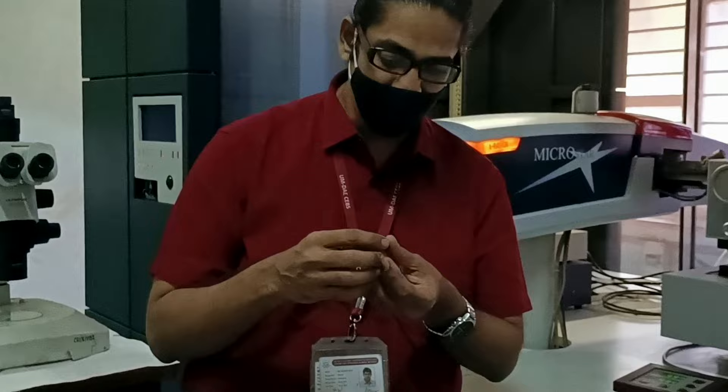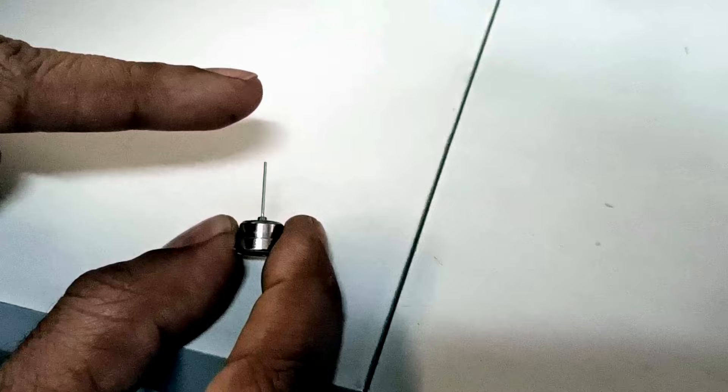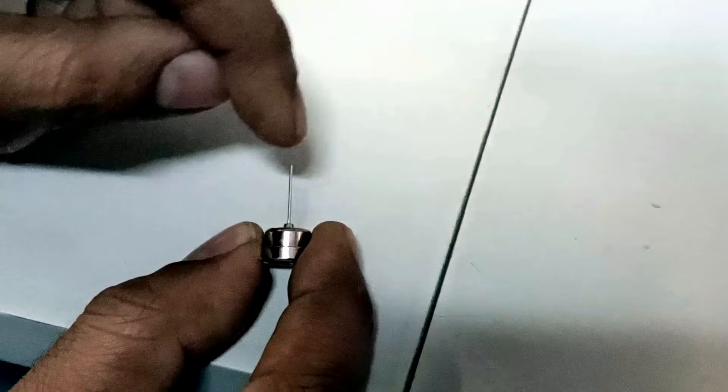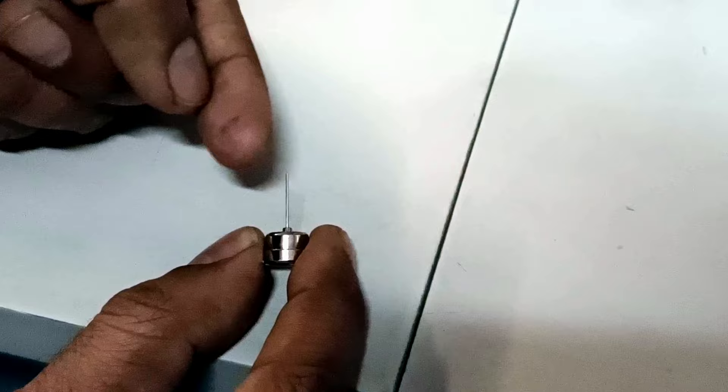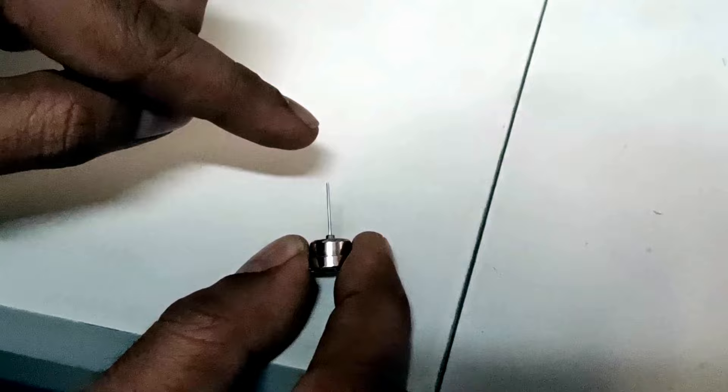Without cryoprotectant you'll start getting ice rings. To demonstrate, I'm going to put my loop into water. The loop looks like this — there's a base, then a pin, and on top of the pin it looks pretty much like a tennis racket or badminton racket. I'll show you what the loop looks like in an image.